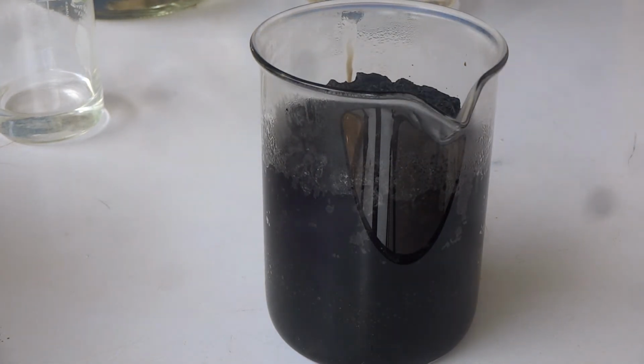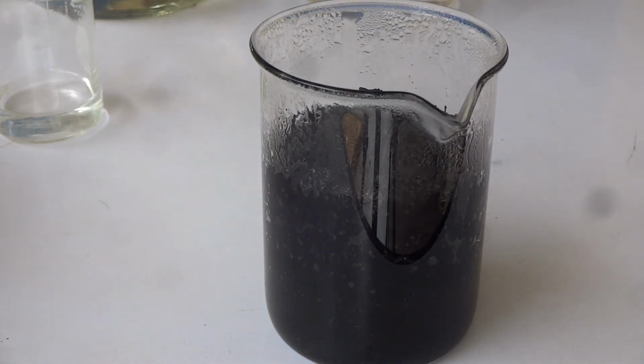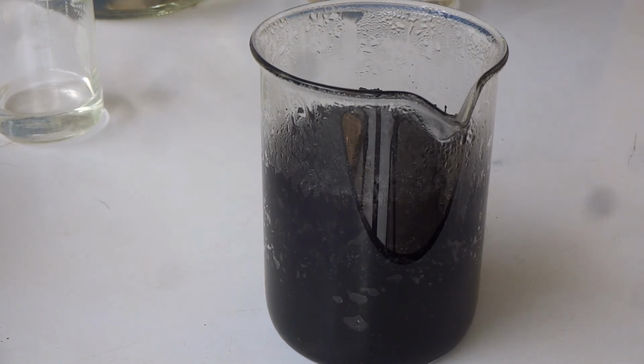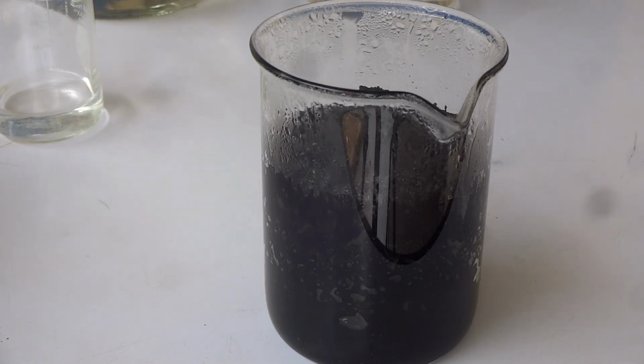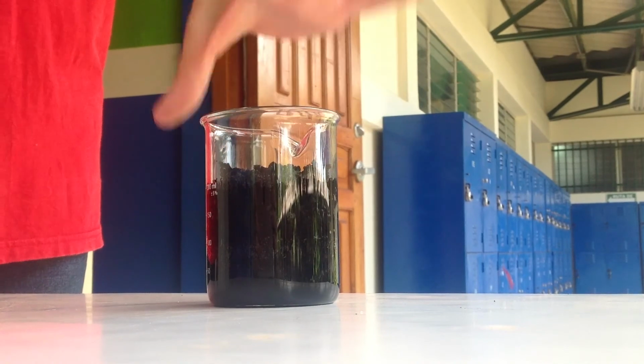So, what evidence do we have that a reaction is taking place? Okay, so you can definitely see water vapor being released and condensing on the sides of the container. You can also see a black crunchy solid being left behind, and man does it smell, and it burns my nose. Oh, that's hot.